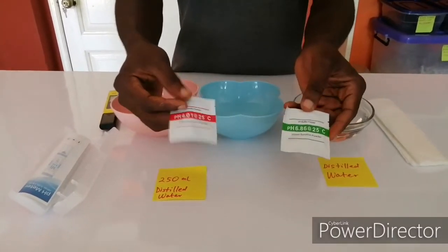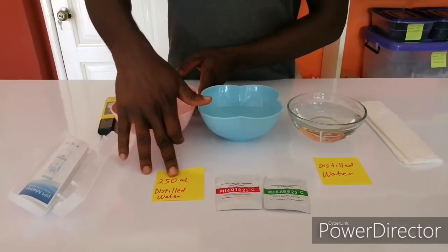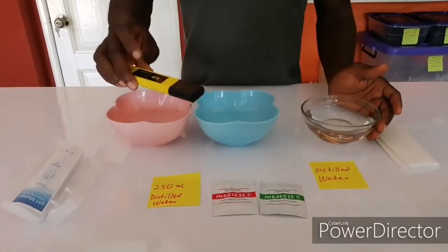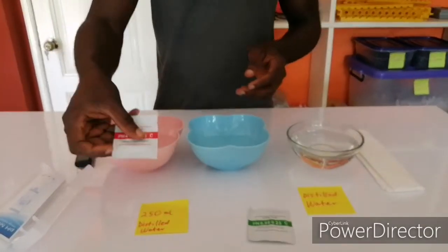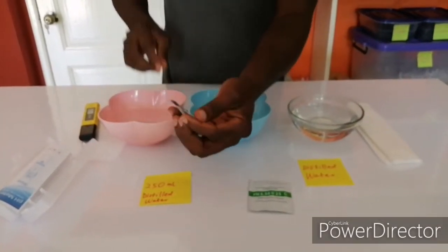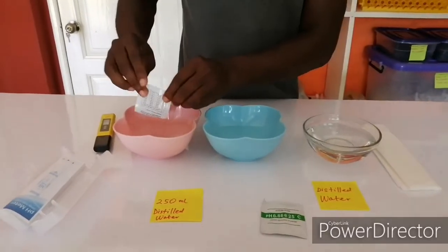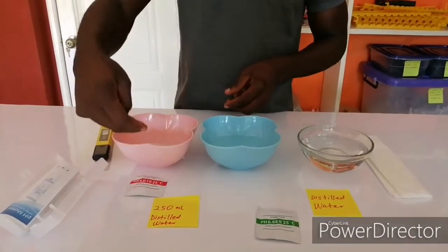You need these two buffer powders and three bowls. One is going to take 250 ml of distilled water, another 250 ml of distilled water, and then the third bowl of water is for rinsing your pH meter after dipping in any of the solutions. I'm going to tear this open, and then pour it onto the 250 ml of distilled water. Don't throw the packet away — just put it beside the bowl so that you know which solution it is.